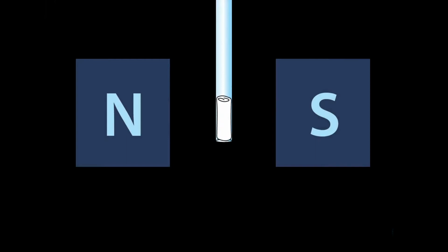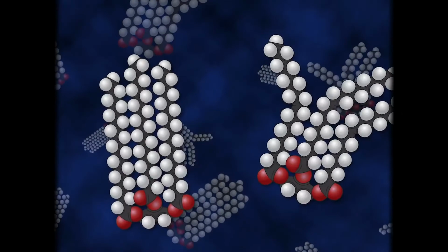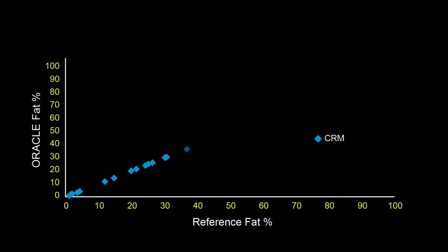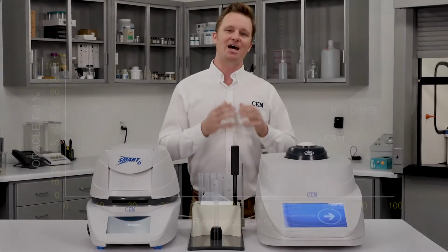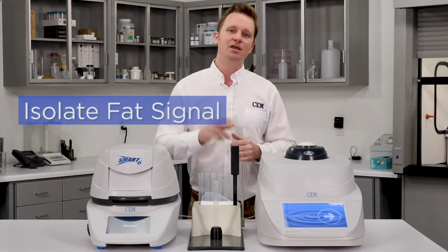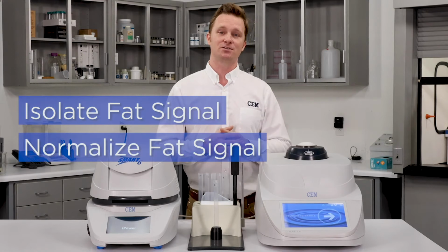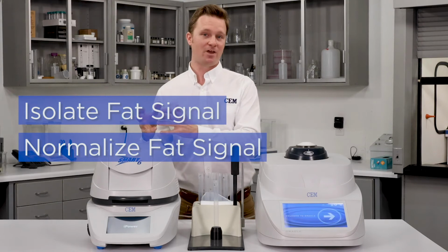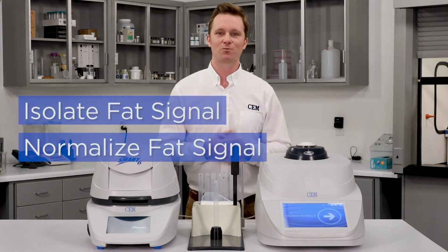The ORACLE Universal Fat Analyzer is based on NMR technology, but unlike other NMR fat analyzers on the market that rely on free induction decay or spin echo pulse sequences, the ORACLE uses a proprietary pulse sequence that enables us to do fat analysis with no method development and no calibration. That's enabled by two major breakthroughs. The first one is that we're able to isolate the fat signal from all other components, removing any interference from the measurement. The second is that we're able to normalize the fat signal, so regardless whether that sample is plant-based, animal-based, or even synthetic-based fat, it doesn't matter, we're going to get the same uniform response.